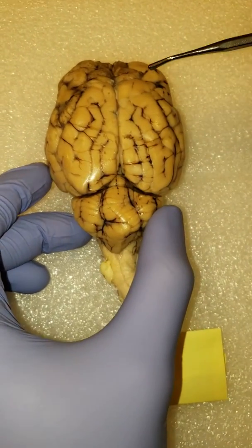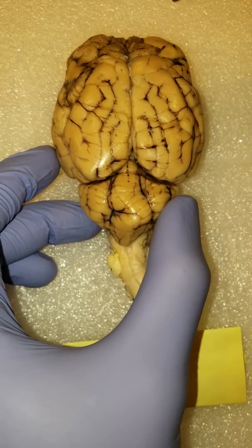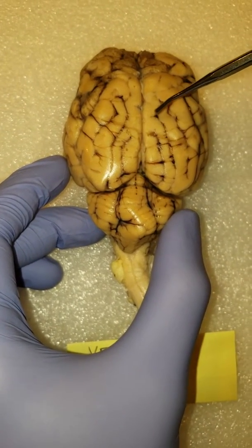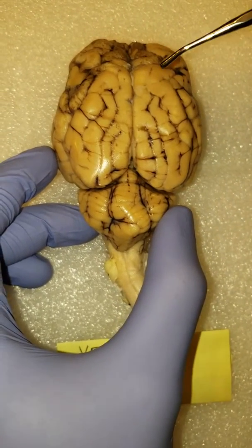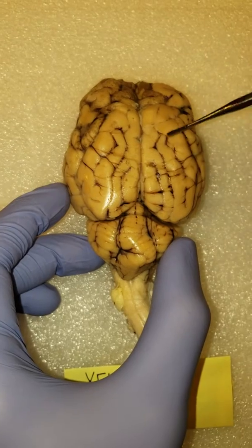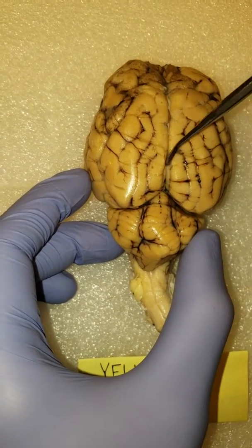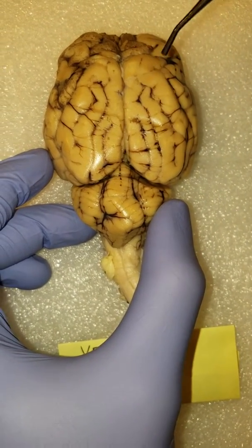Now, you'll notice various other landmarks on the brain, namely a bunch of grooves and ridges. The singular terminology for these things are the gyrus and the sulcus, and that would be your ridges and your grooves. They're a little bit less defined in sheep's brain when compared to human brains. And gyri and sulci are the plural terms for these things. But you can see them all over the brain, these small little ridges and grooves. This line that separates both the left and the right hemisphere is called the longitudinal fissure.